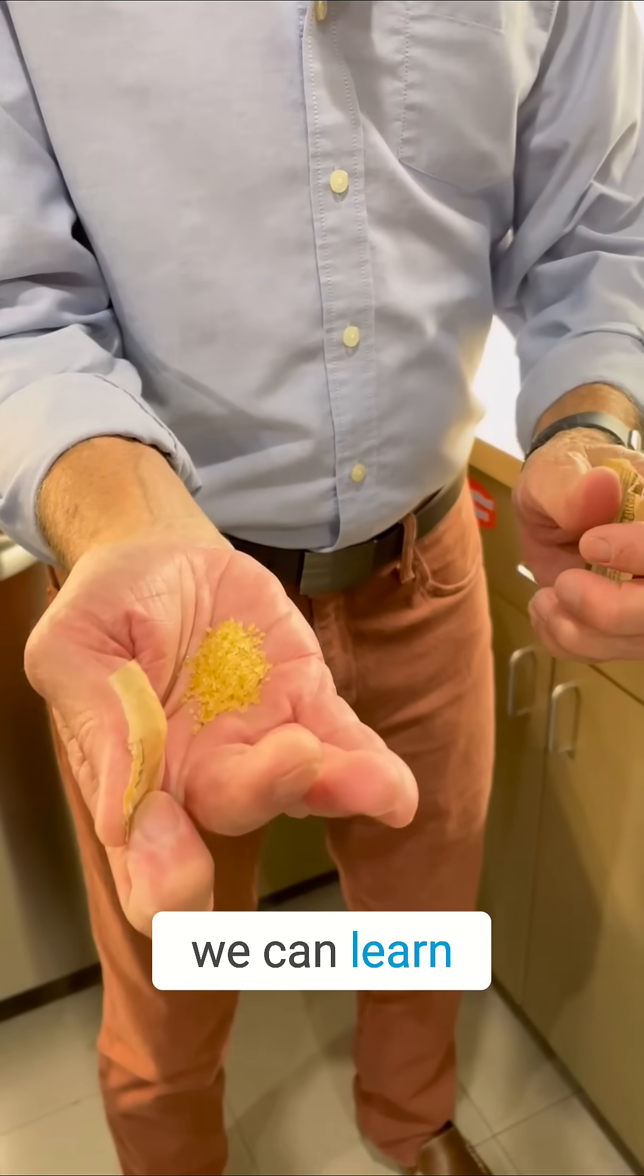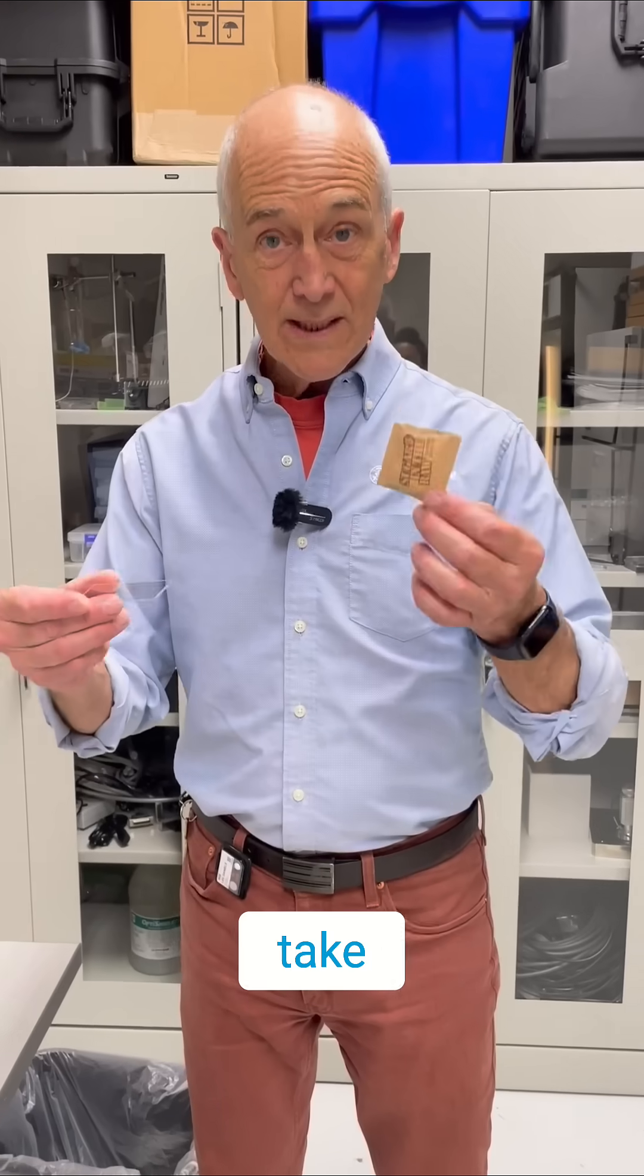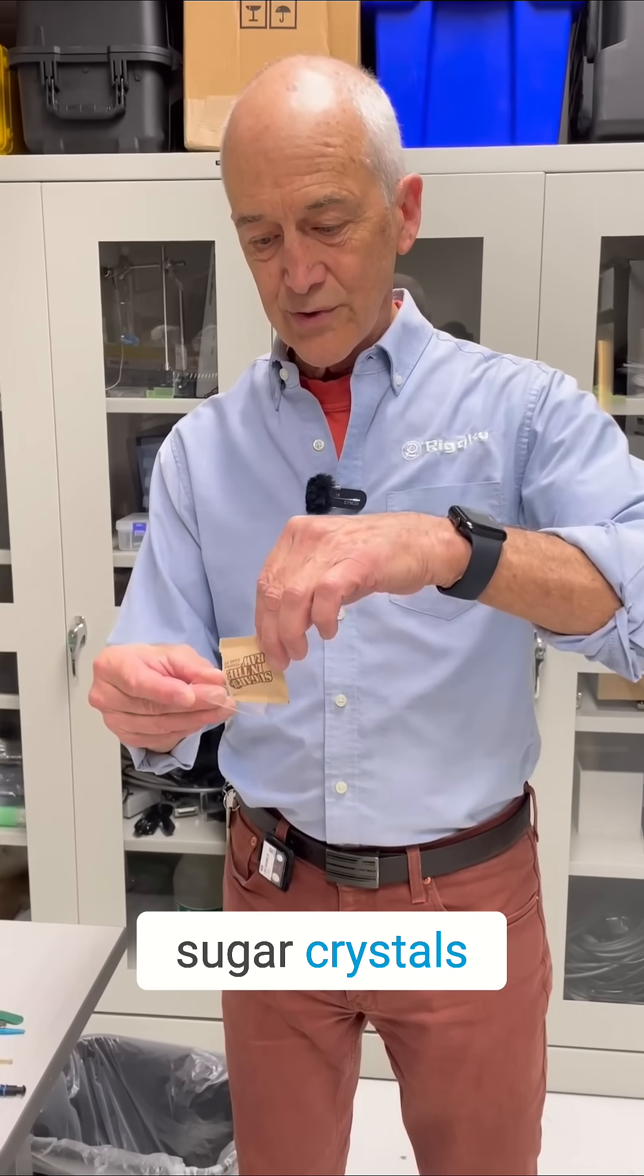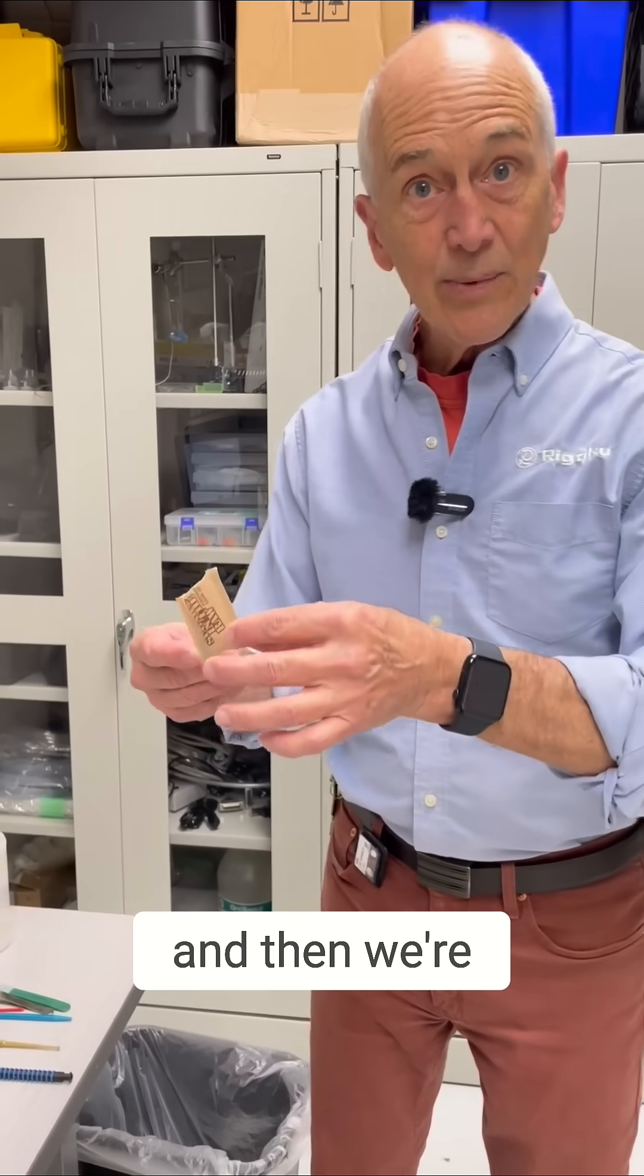So I'm going to take a few of these sugar crystals and put them on this slide, and then we'll look under the microscope.